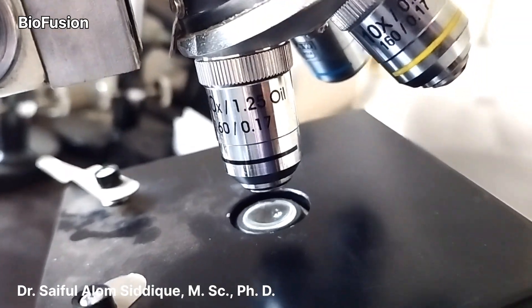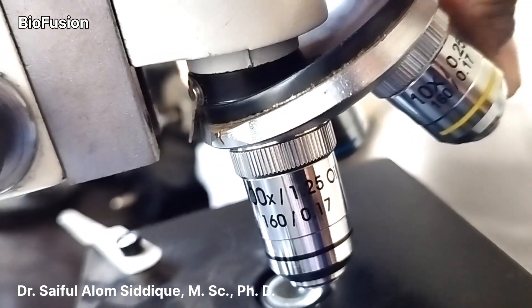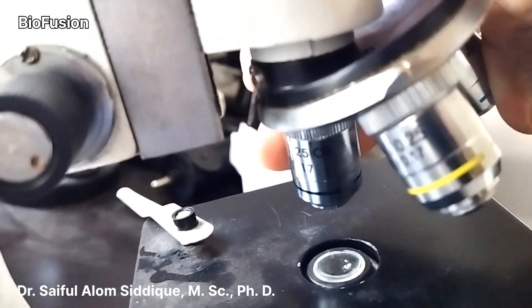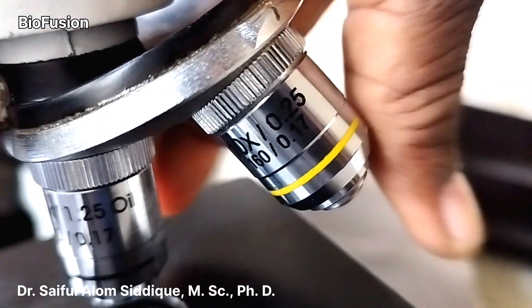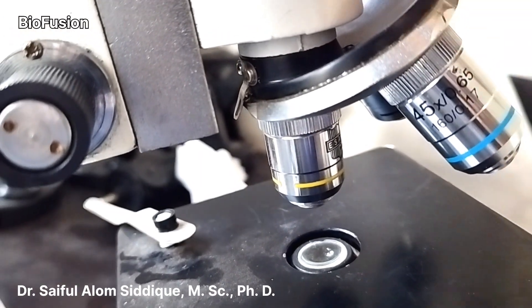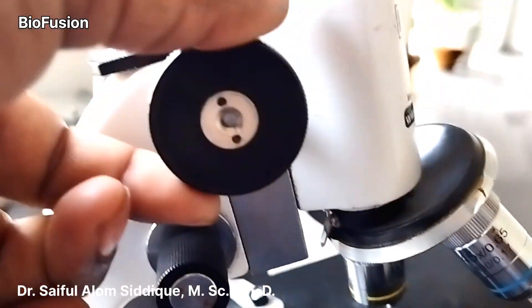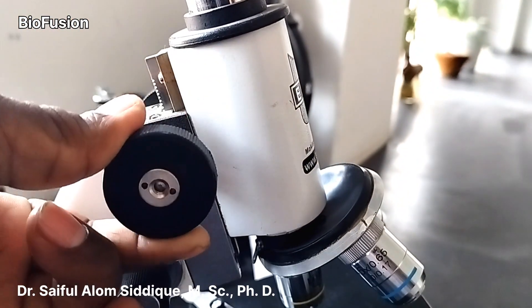This is the objective lens. There is another objective lens — the magnification is 100x, 10x, and 45x. So, with the objective lens you will have magnification. If you have a 10x objective lens with a 10x eyepiece, you will have 100x magnification. With the 45x objective lens and 10x eyepiece, you will have 450x magnification.